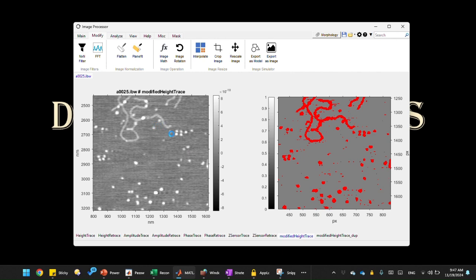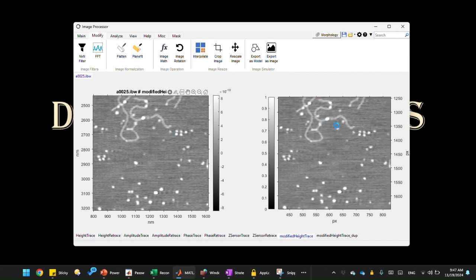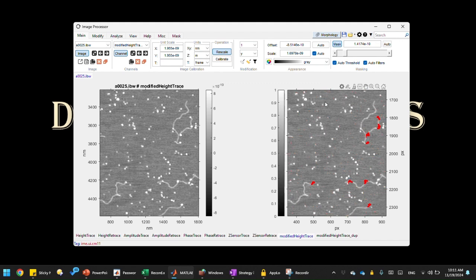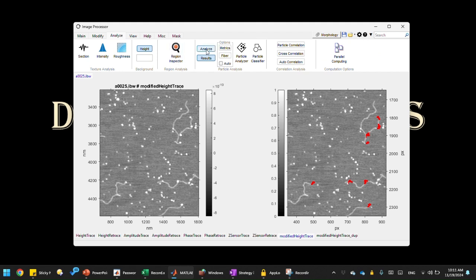Let's go back to our raw data because that script requires the raw data to perform. In order to mask the protein DNA complex without masking the whole DNA or the free proteins, we can use a custom script in the morphology operation. It's called mask protein DNA. I covered this already in another video, so here I'm just going to click this. As you can see, the protein DNA complexes are masked, and all the other noises are not masked. That's what we want, those are the particles we want. So then let's do the particle analysis. Click Analyze.